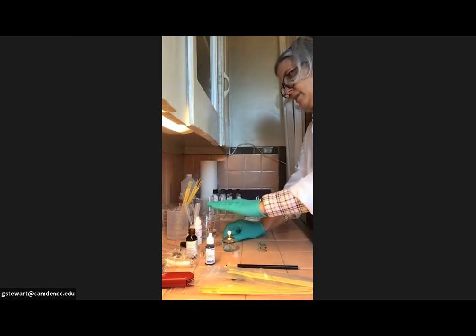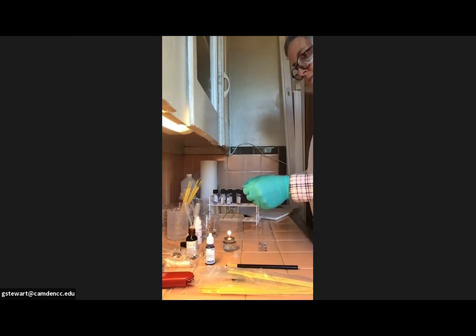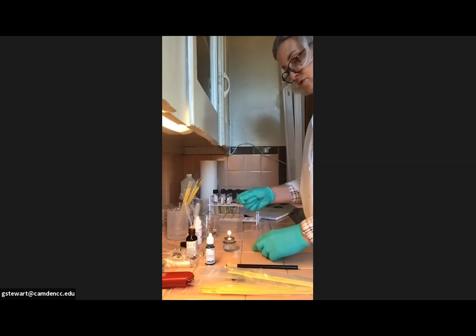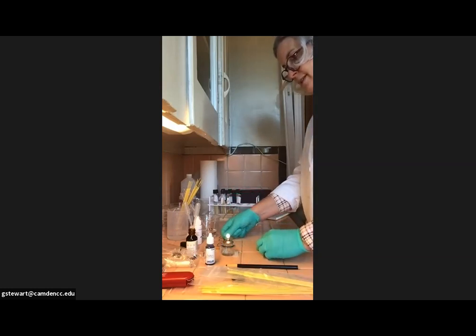I can hold my hand about this far up. So I am going to warm my slide a little bit to help it dry, but I think I'm going to pause our video for now because we can't continue until these slides are dry. So I'm actually changed my mind there. I'm going to set these aside.